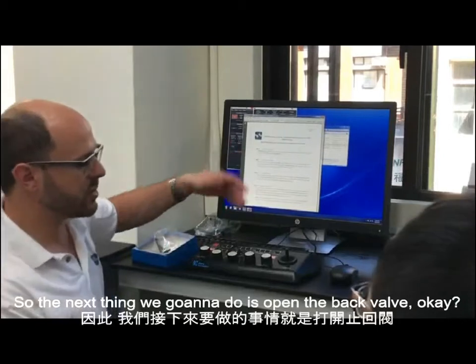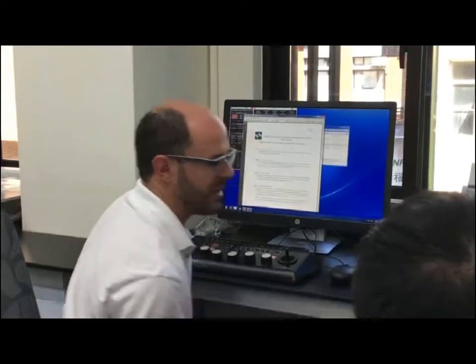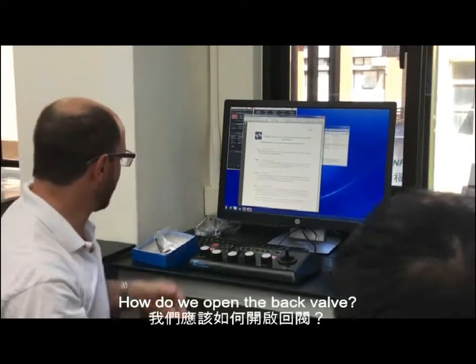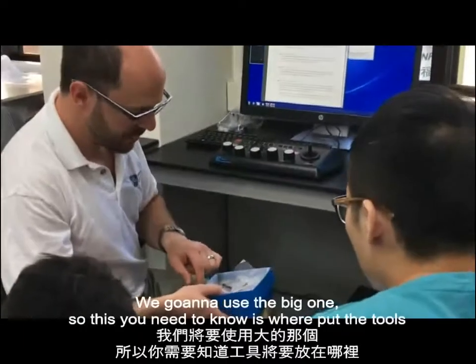So the next thing we're going to do is open the back valve. Okay, so we've spoken about 2 valves already. We've spoken about the airlock valve, we've spoken about the inner valve, and there's one more valve called the back valve, and it's called the back valve because it's in the back. How do we open the back valve? So inside this box, we have 2 keys. One of them is big and one of them is small. We're going to use the big one.